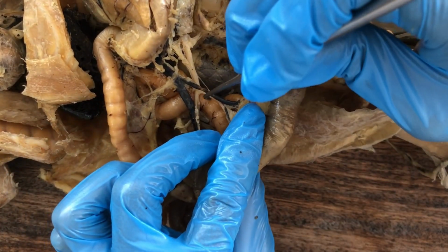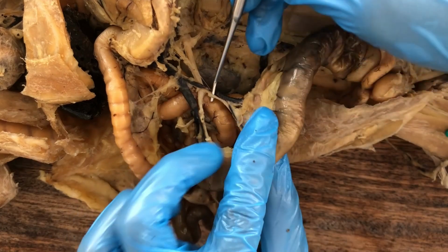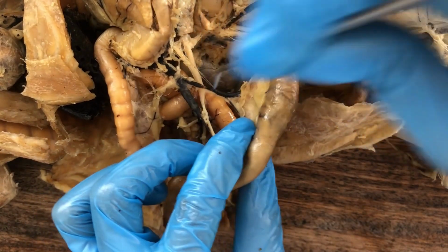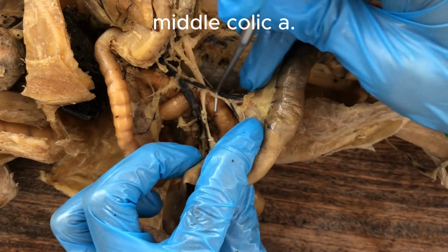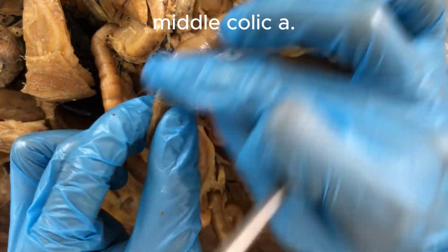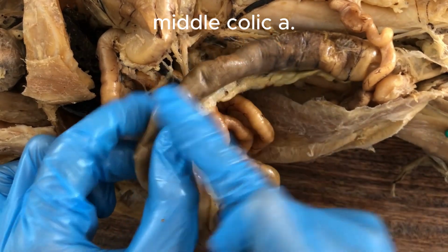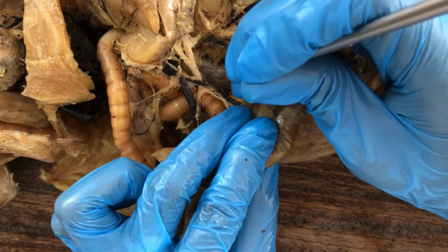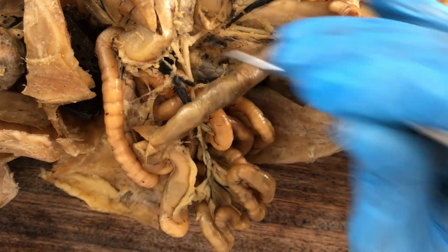And then the last branch of the superior mesenteric is this one. That's the middle colic artery. The middle colic artery supplies blood to the transverse colon and also the proximal portion of the descending colon. So that's the middle colic artery.